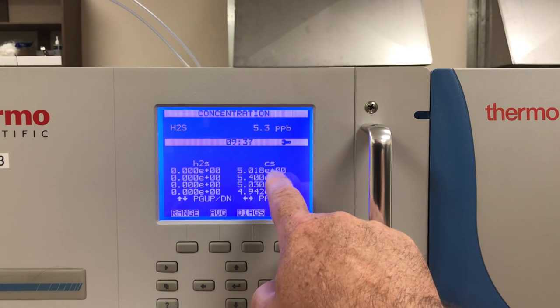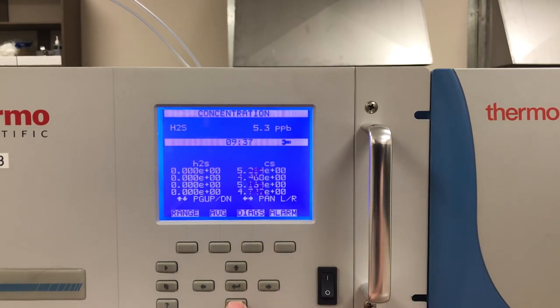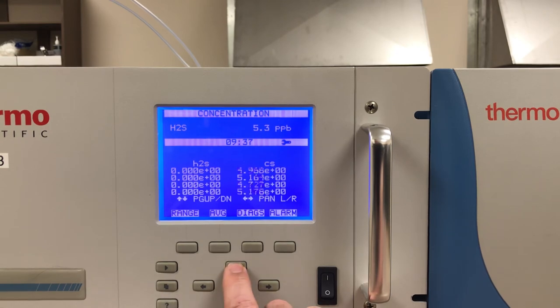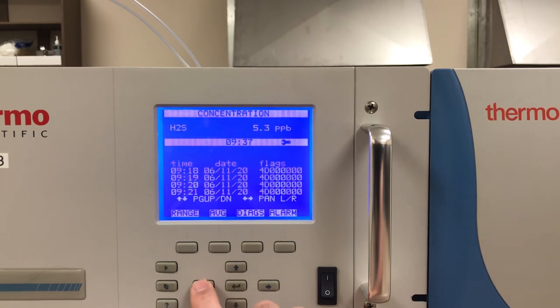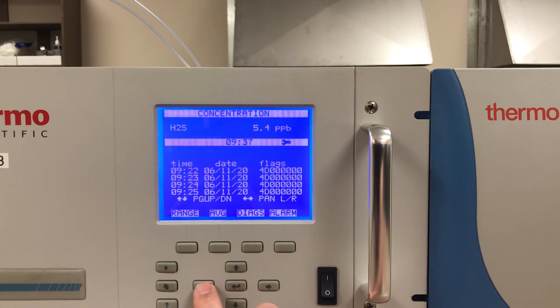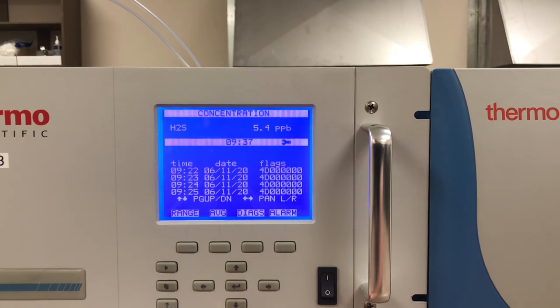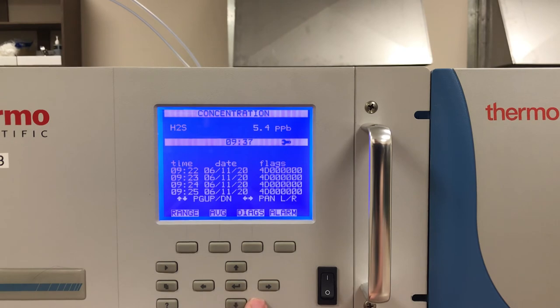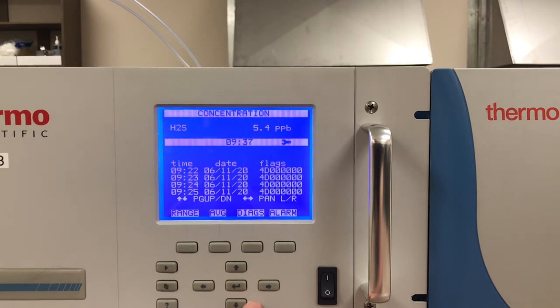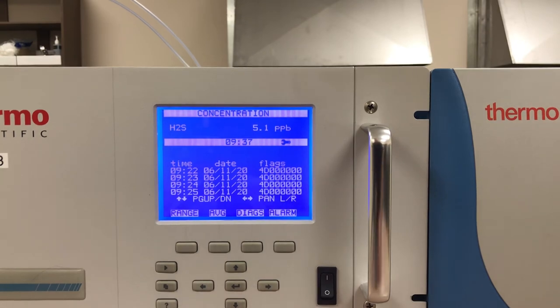It uses exponents for decimal placement, and I can arrow down to look through the data on the i-series. Again, if you want to download an Excel file, you have to connect iPort to the back of the instrument, download the .dat file, and then open it with Excel.